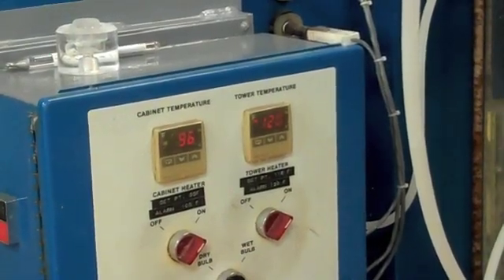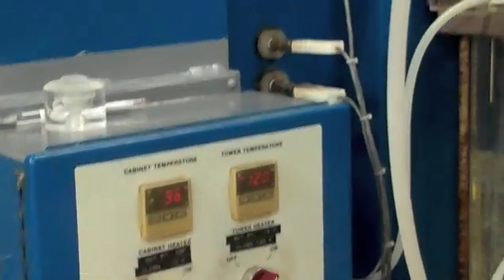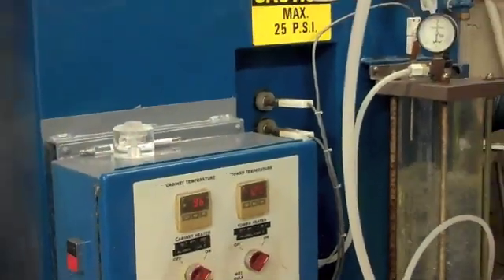It has to be a little hotter going in to maintain the internal cabinet temperature, which is typically 95 degrees optimally, but a range of 92 to 97 degrees Fahrenheit is standard. Today our cabinet is running at 96 degrees. Let's take a pause so we can open up the cabinet and talk a little bit about collection rates.